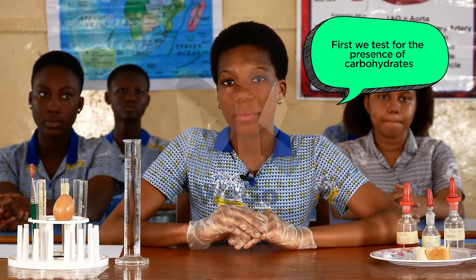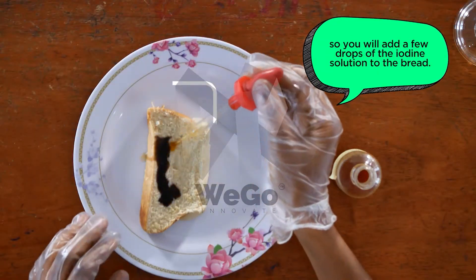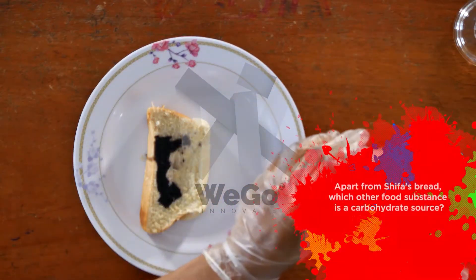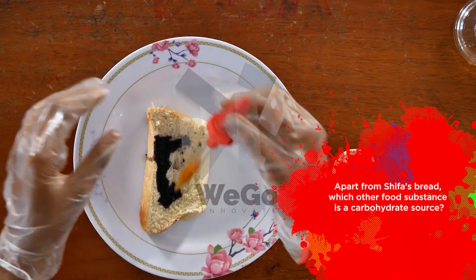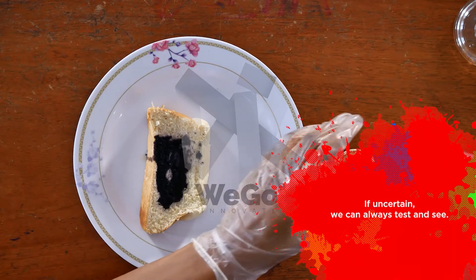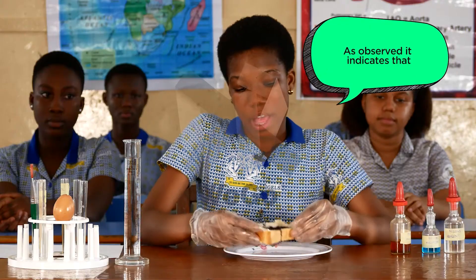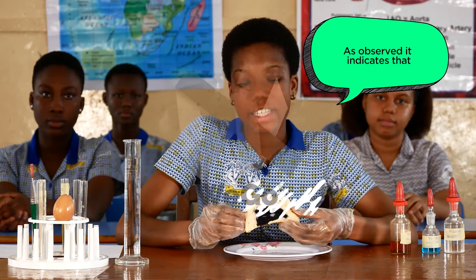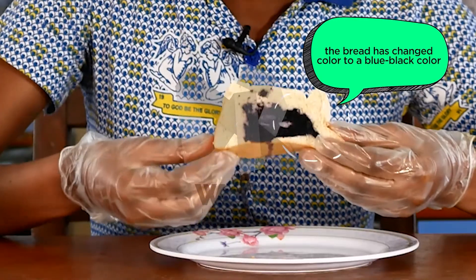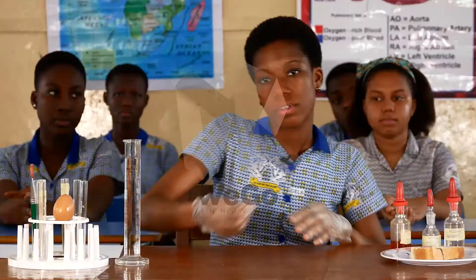First, we test for the presence of carbohydrates. You add a few drops of the iodine solution to the bread. Apart from Shifa's bread, which other food substance is a carbohydrate source? As observed, the bread has changed colour to a blue-black colour, which shows the presence of carbohydrates in the bread.